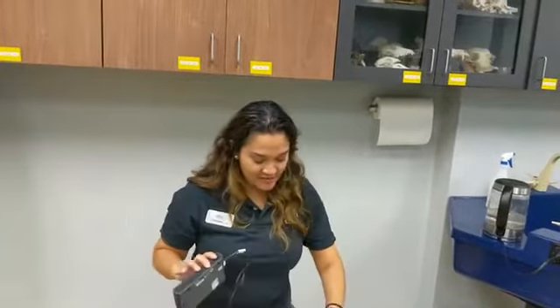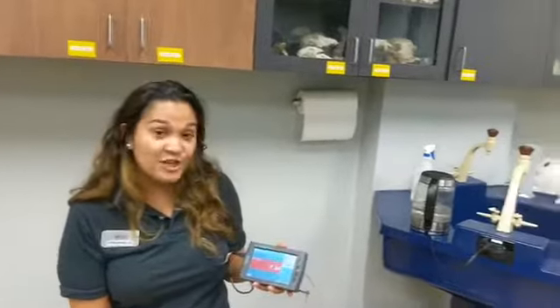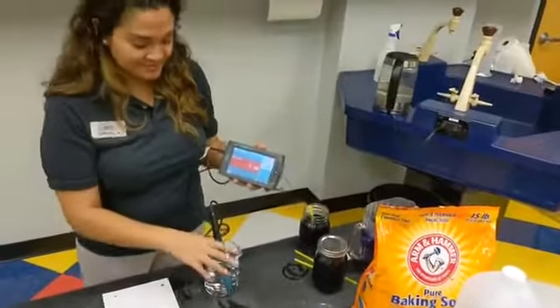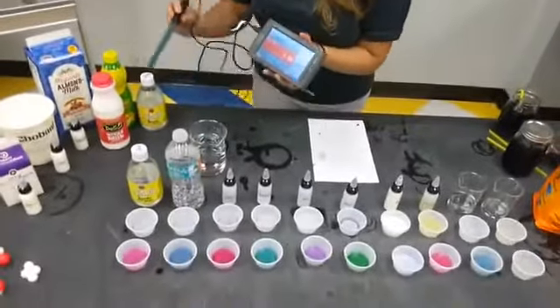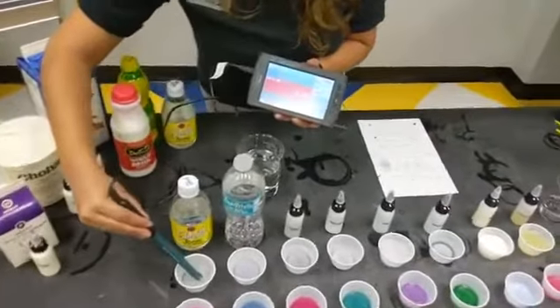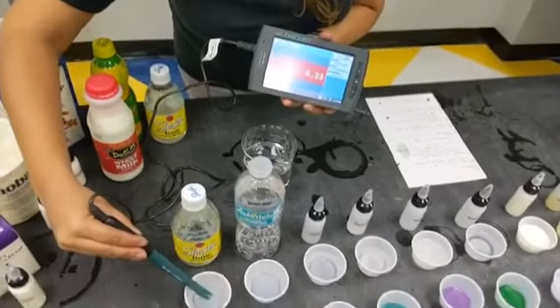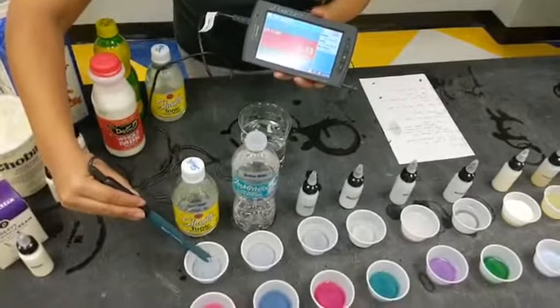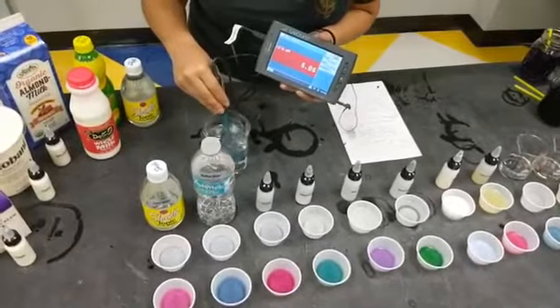All right, so we have had some technical help with our meter. And so now we want that number to be changing a little bit because it does fluctuate. So we have our water that has a pH of about 7. We're going to move to our first sample here, and that is the soda water. Right, our soda water is more acidic. So it's hovering around 4. All right, so that's definitely an acid. It looks like we double checked and it was pink, so that works.